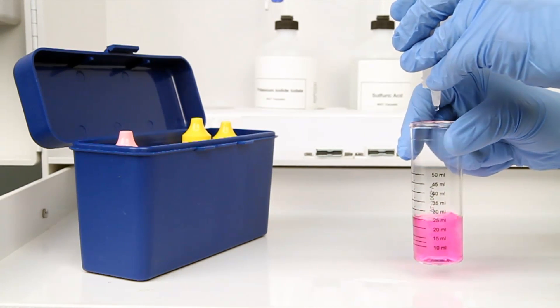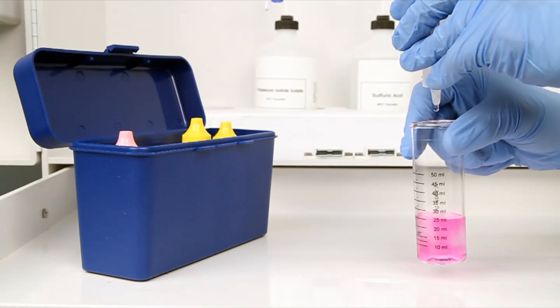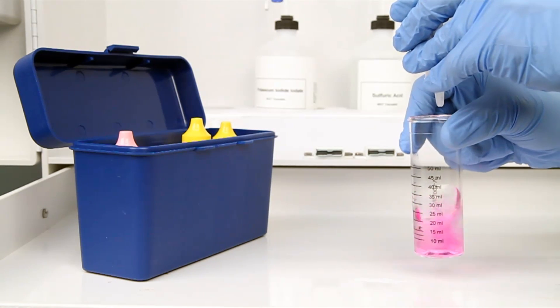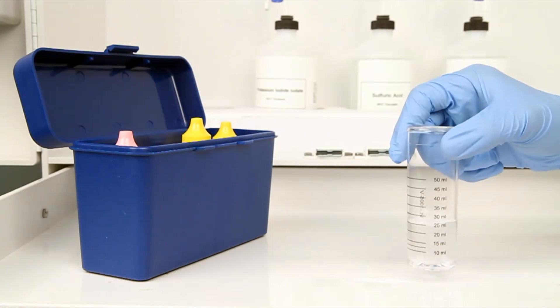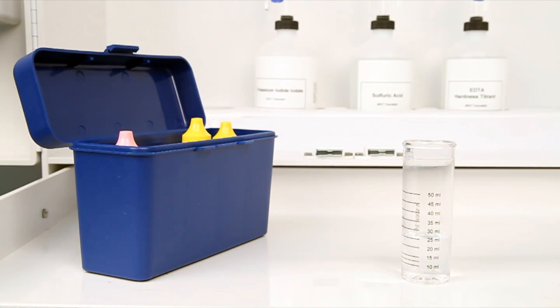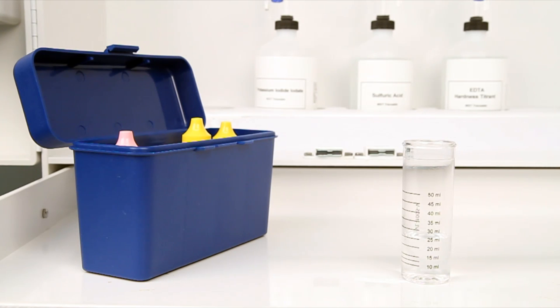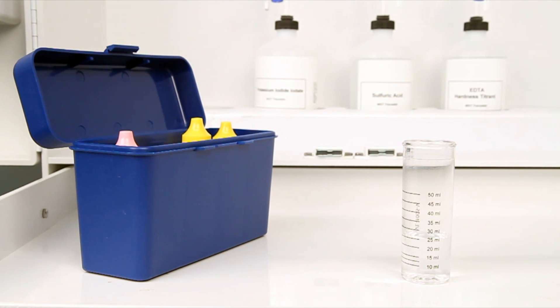After the addition of each drop of titrant, it is important to swirl the vial to make sure the reagents are properly mixed. The alkalinity has been neutralized when the sample turns from pink to colorless. If the sample had not turned pink, the addition of the alkalinity titrant can be skipped.